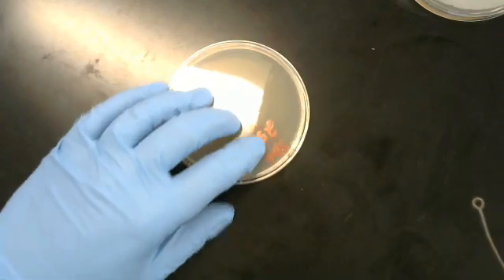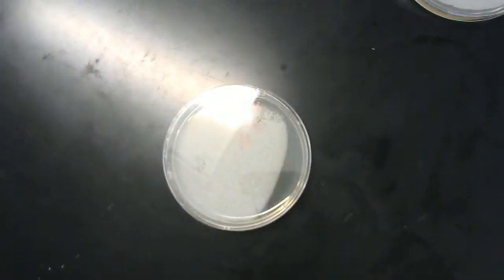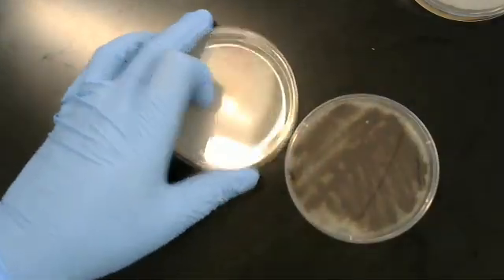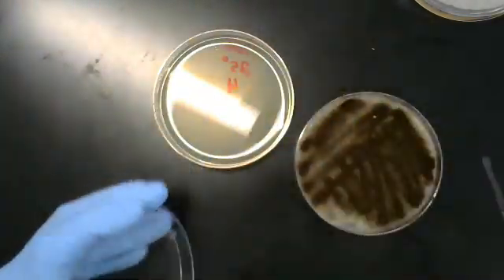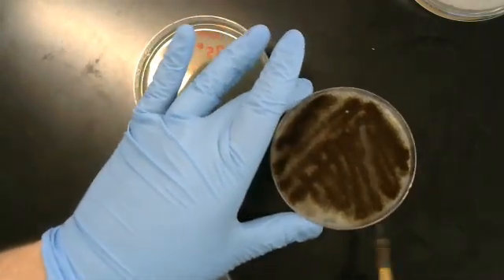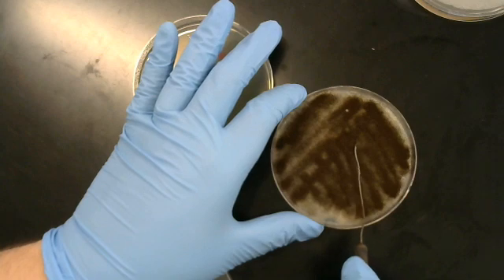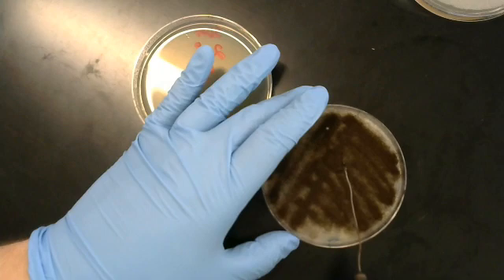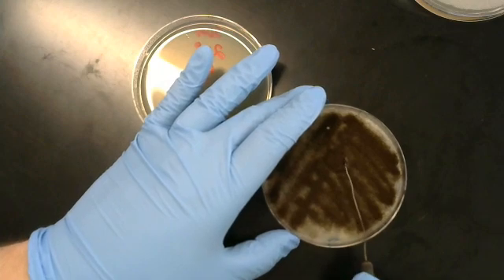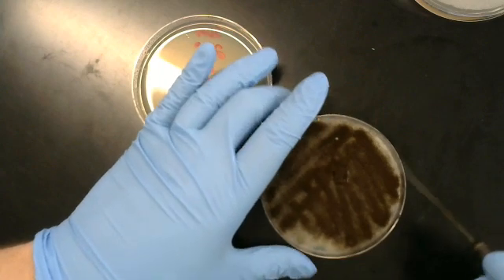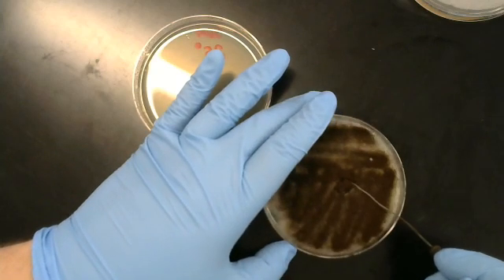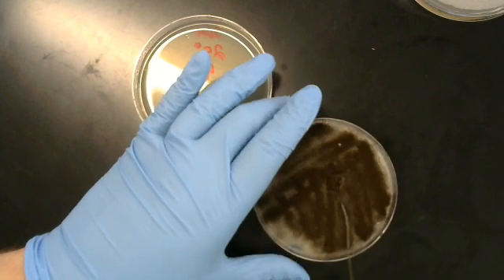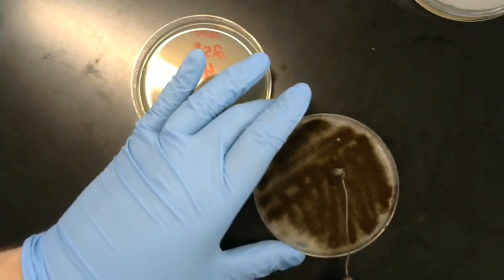We have our last one. And here's another mold. This one's going to be a touch easier because it's not as spidery as the others were. You don't have the large growths at the top. You just have this section here, so this is going to be a lot like the first one. It will be relatively easy for us to tease out a section of agar.